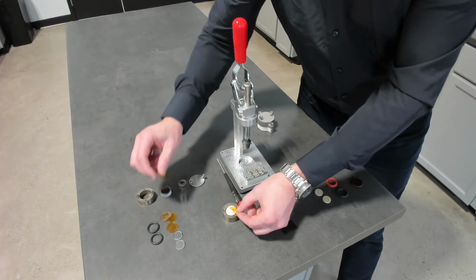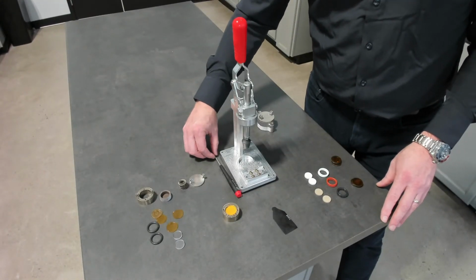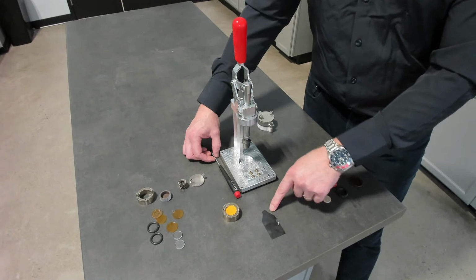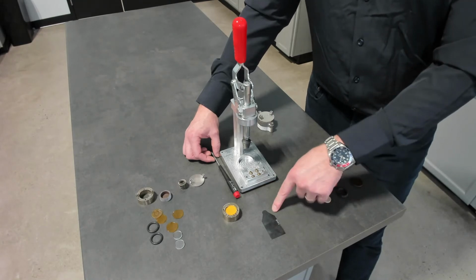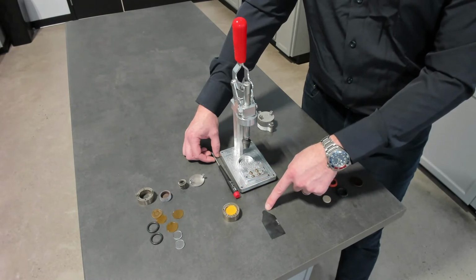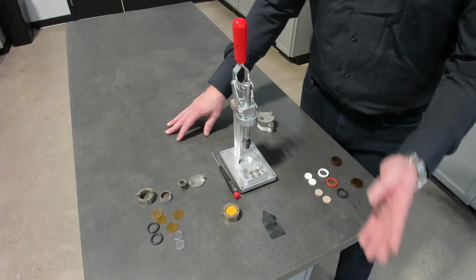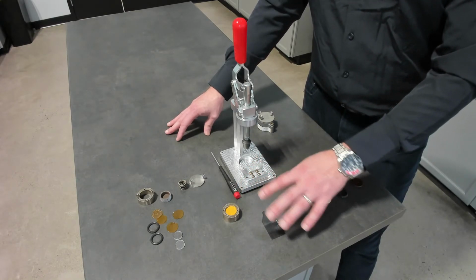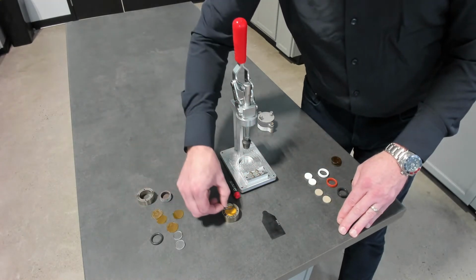One of the main goals of this was to have polymers that never touch the sensors. What that means is, as it's going through the melt, the polymer is never in direct contact with the sensor. Otherwise, it would destroy the sensor. It's very hard to remove those polymers after a melt if they're in direct contact with the sensor. Because we're able to see the contact resistance between the sensor and the sample, as the heat travels through a layer of Kapton, which you'll see as we configure this, we can remove that portion of time. So anything we add, as long as it's a thin layer between the sensor and the sample, we can remove that effect.